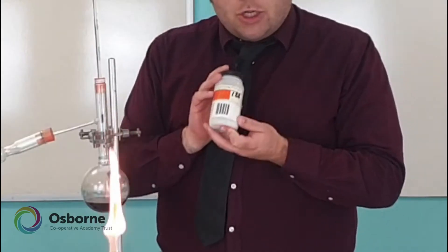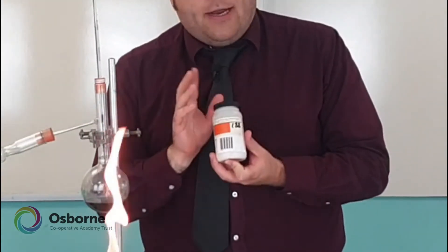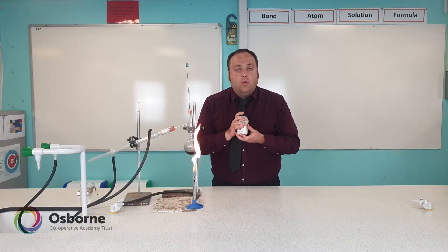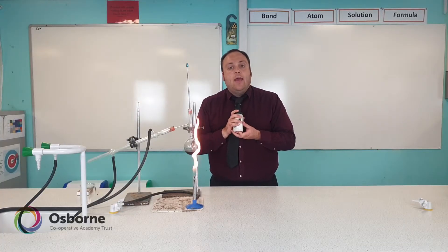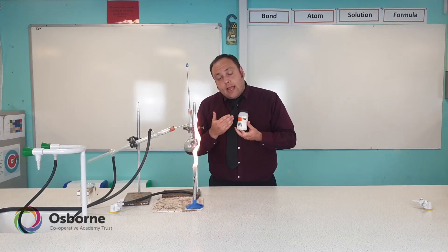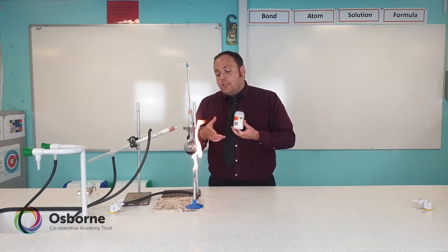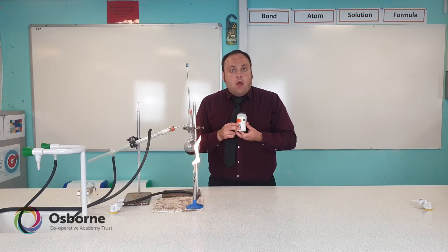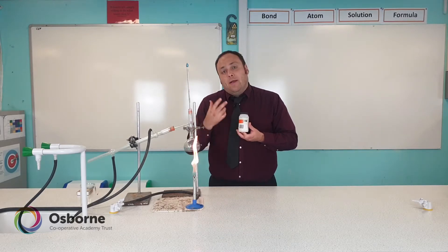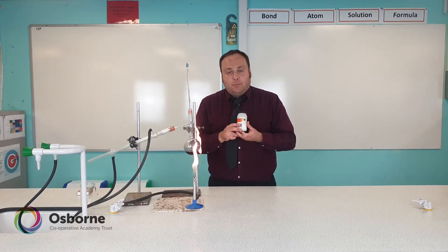These small solid granules don't help to separate the mixture and they don't interfere with the ink or water in any way — they're purely a safety feature. Anti-bumping granules allow for a smoother boiling of the mixture, making it less likely to over-boil or cause what's called flash boiling.